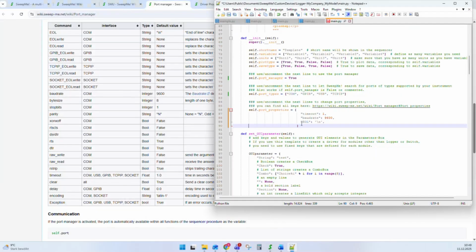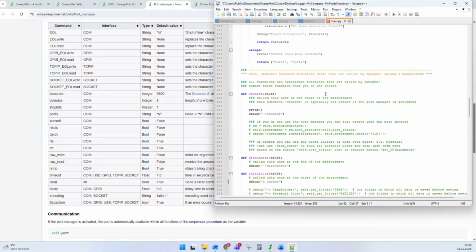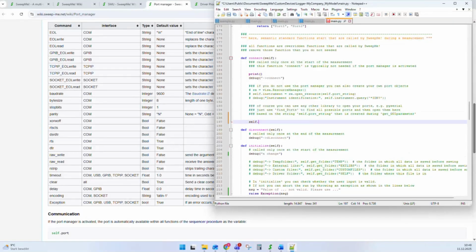And the idea is at the end you get a port object that is completely configured. It has all the properties that you need. It is from the correct type. It is open, and in connect, this self.port object is now ready to go. It is not added here in the example, but I can just add these lines. Just starting from connect, you have this function self.port.write available.